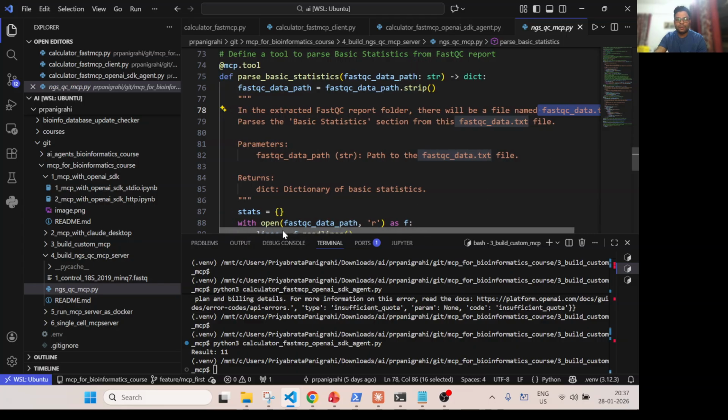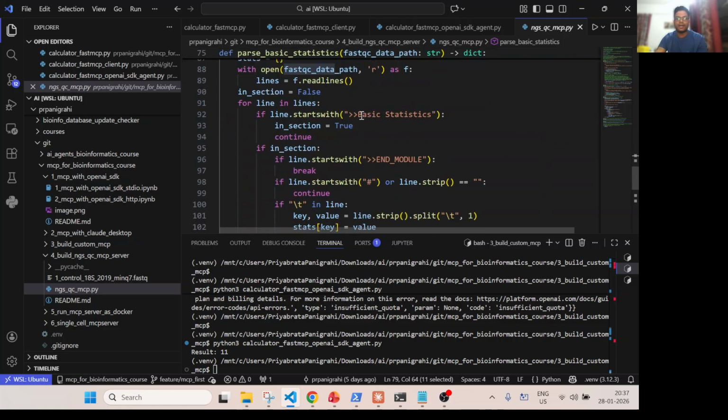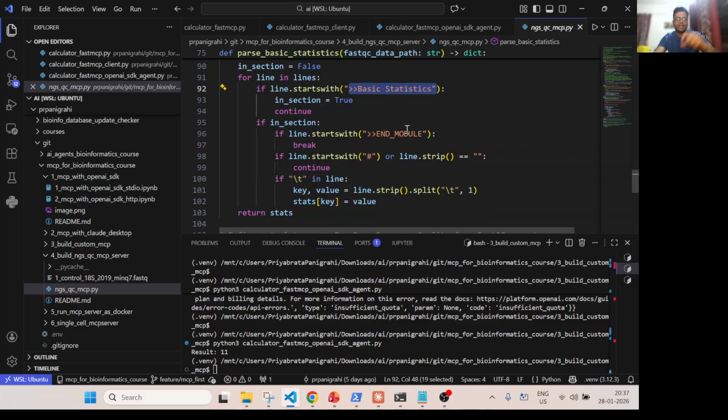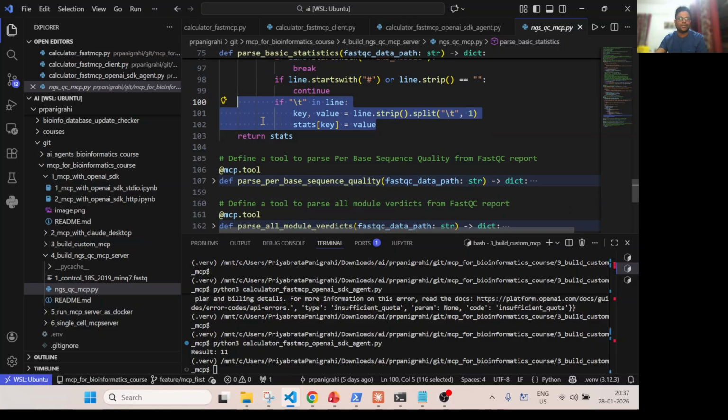So this function parses the basic statistics section from this file. I will show you when it runs, and I will show the file content over there. Here I have to tell where this file will be present, so that the agent will know, generate that path and send it. And this is very simple. From that output I'm just parsing the basic statistics, and it will give me a response like the overall QC summary.